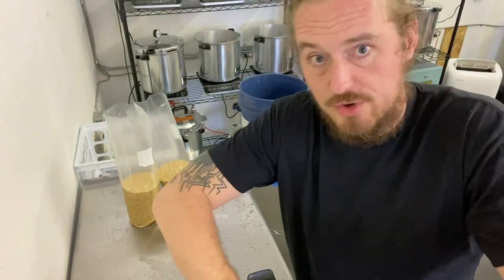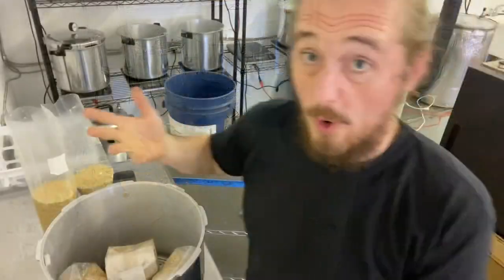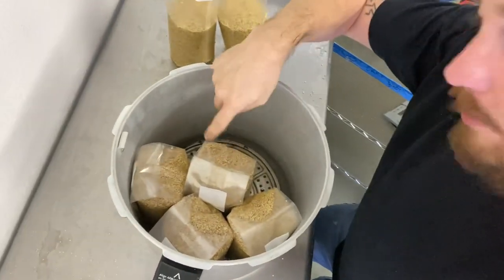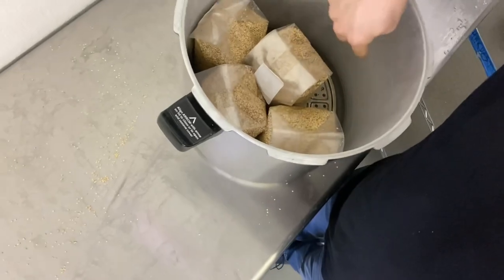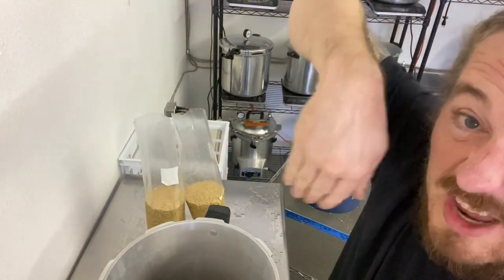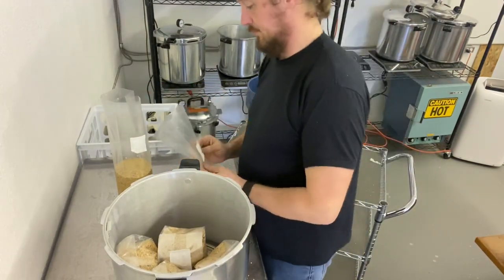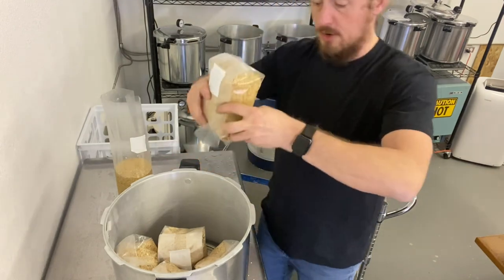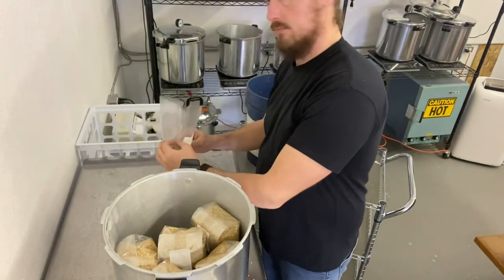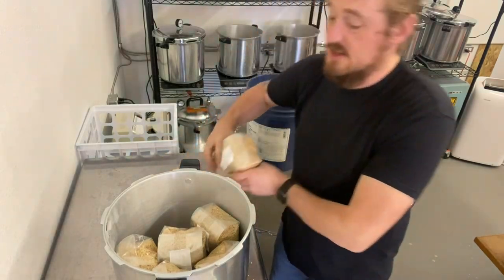I'm trying to get this set up so I can show you the layout. So let me show you how I've packed this bag so far. We've got one, two, three, four bags in here. You can see the filter patches are all facing against the side wall - I just happen to like that, and it holds the bag fold down nicely. Take it, fold it down, make sure it's tucked up against the bag, slide it in. Now you get to do this eleven more times.